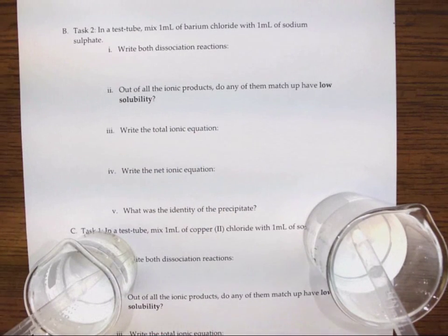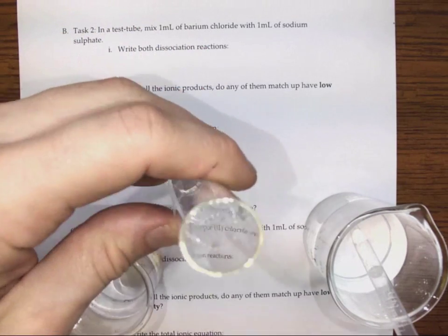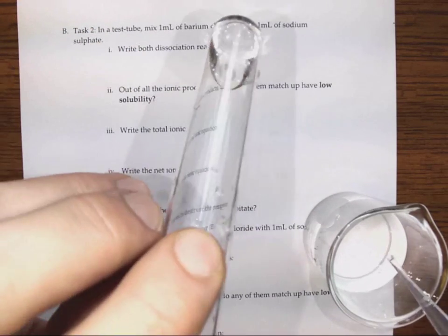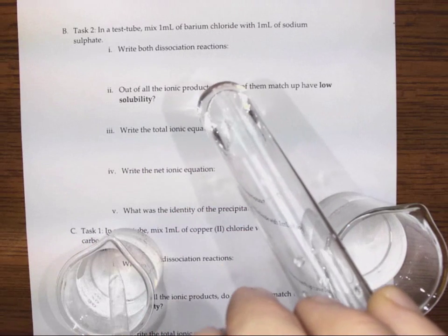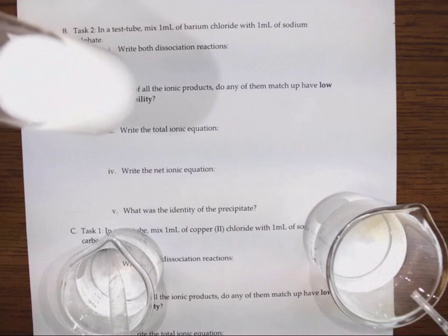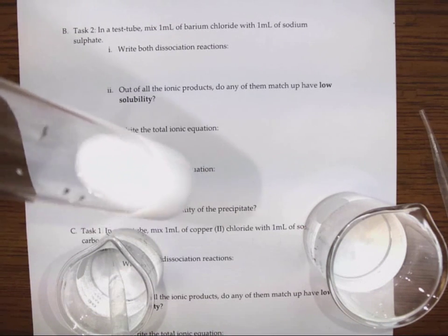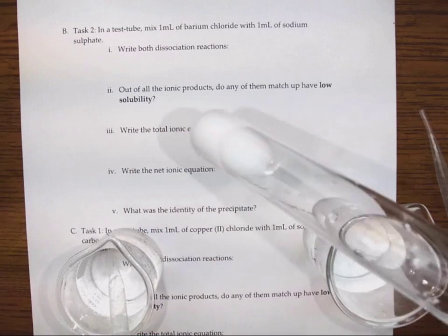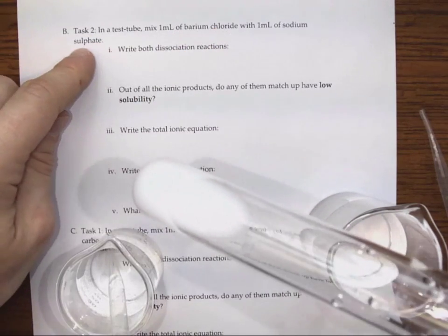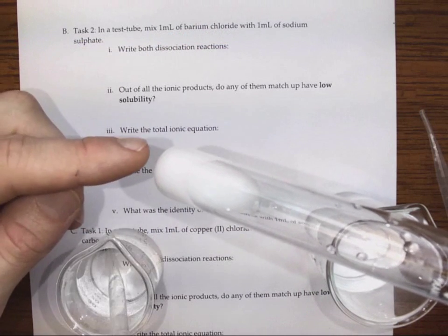So these 2 mixed together, we're going to see if they make a solution or a precipitate as well. So you can watch as I add some and see if we see any obvious precipitate forming. And we do. In this case, the precipitate is white. And it's kind of milky. And we're going to see if that settles as well. So I guess what I want anybody who's watching to know is that when we mix these, for sure we get some white precipitate. And the question now is, well, what is the precipitate?